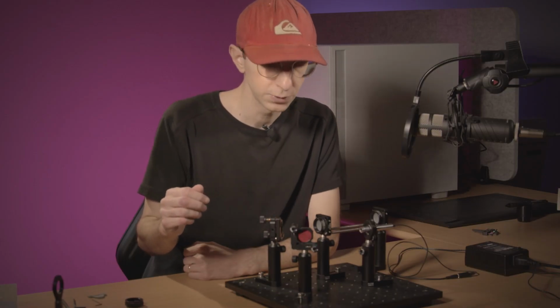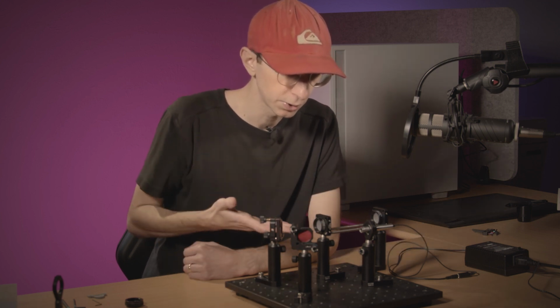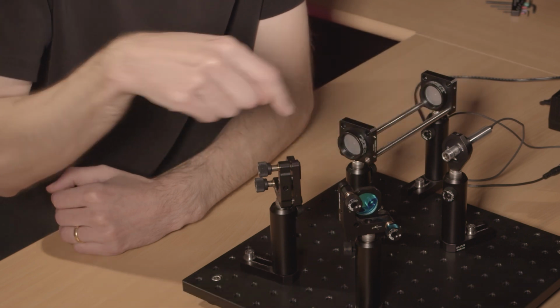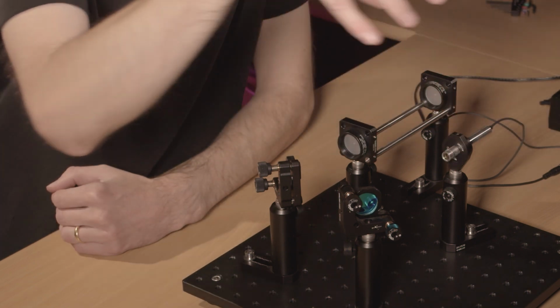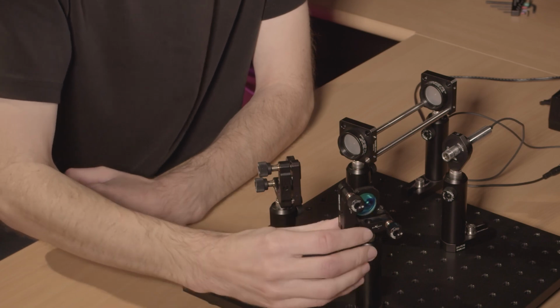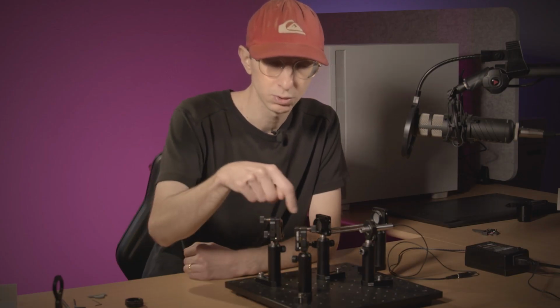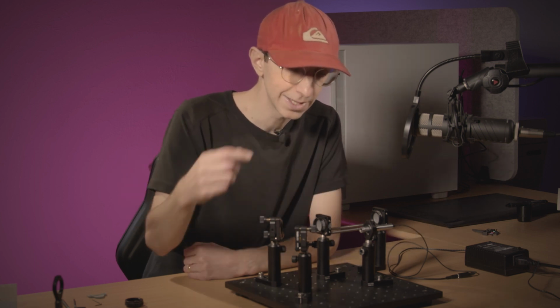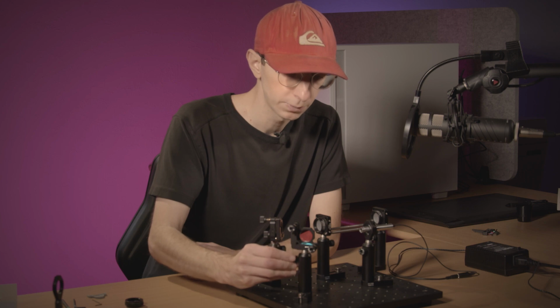And you're basically left with two configurations. You have the U configuration, which is the configuration I'm using here, so it is a U shape. And you also have the zigzag configuration, where the laser is placed the other way around, and we would put the mirror like this. So that makes a zigzag shape. So I will go back to my U-shape configuration.